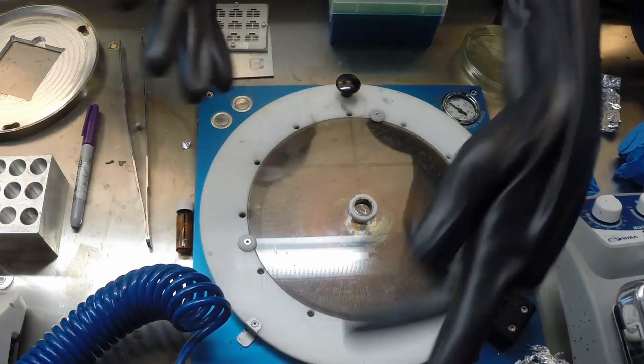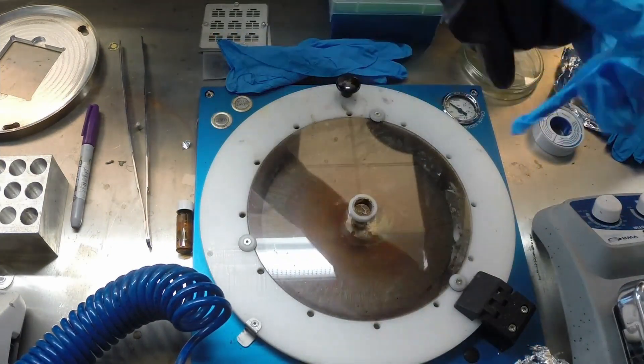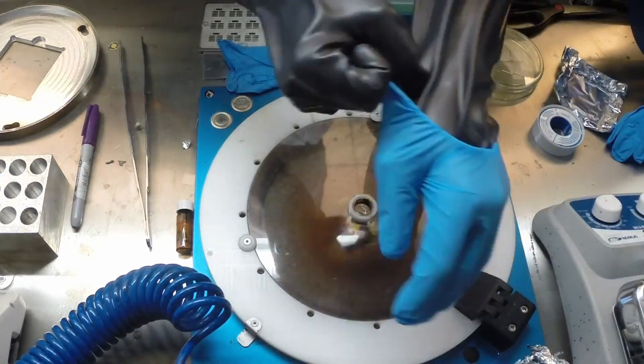Now that the spin coater recipe is defined, we'll place our hands in the glovebox and put on disposable gloves to protect the butyl glovebox gloves from solvents.